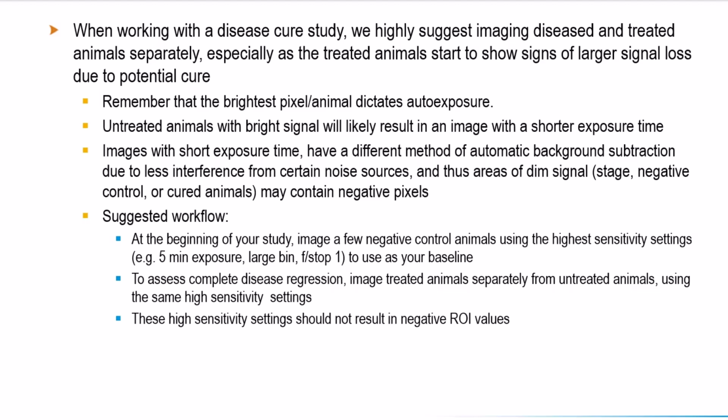Doing so will ensure that your baseline counts are high enough to not generate a negative reading after the software performs background subtraction. When you think you may have eradicated your disease, you should also image those treated animals separately from your untreated animals with the same high sensitivity settings. This will ensure that you're picking up any potential signal, and your counts are high enough to avoid a negative ROI value after that background subtraction is performed.